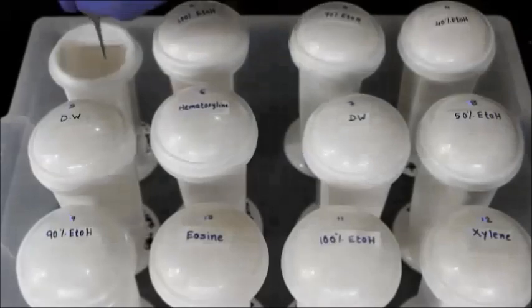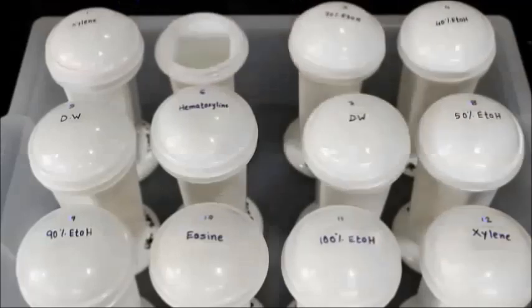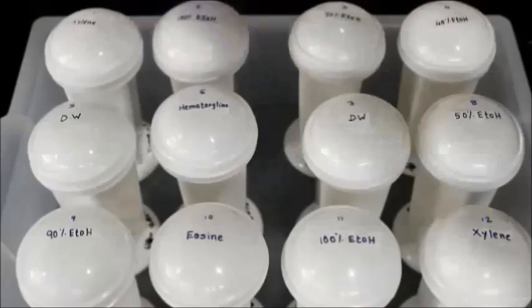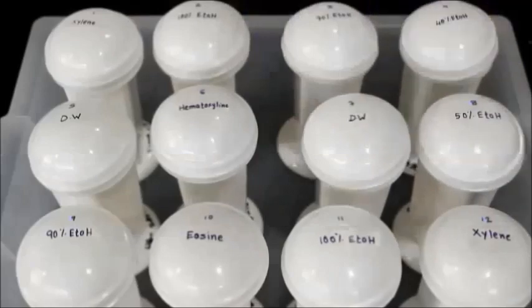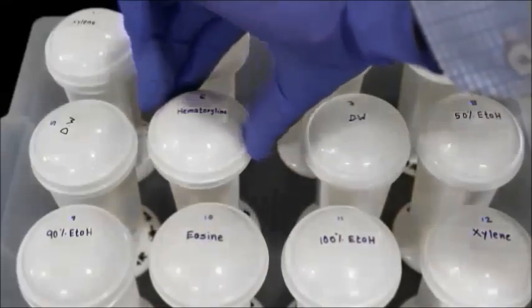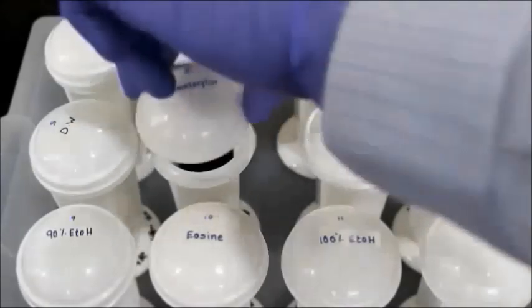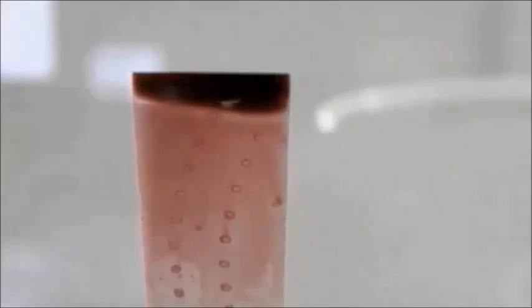Staining is required to visualize the tissue structure. The slides are first kept in xylene for complete removal of wax and then are passed through a rehydration process because hematoxylin is a water-based stain. After staining with hematoxylin, slides are passed through a dehydration process because eosin is prepared in alcohol.